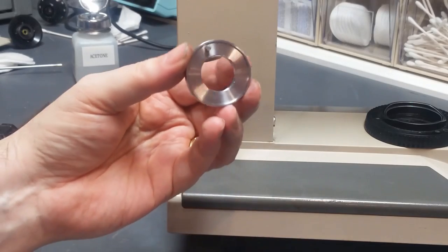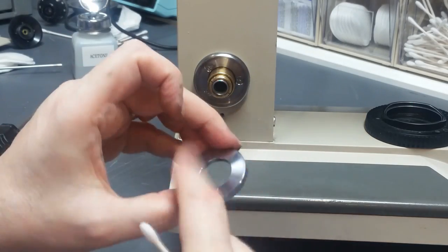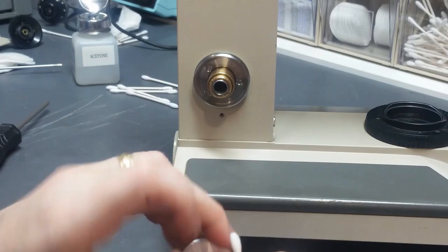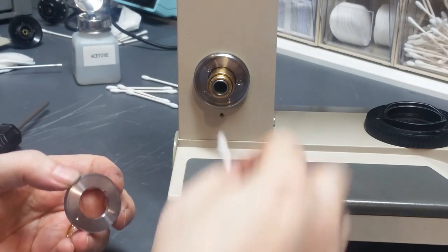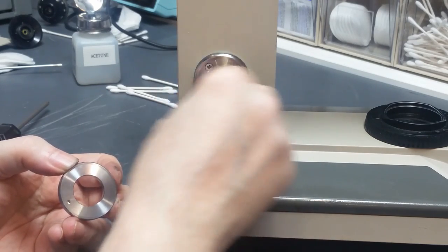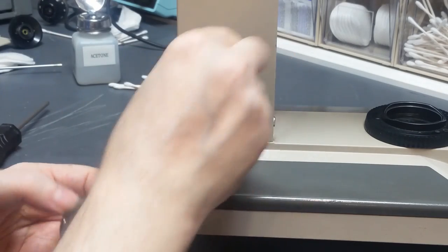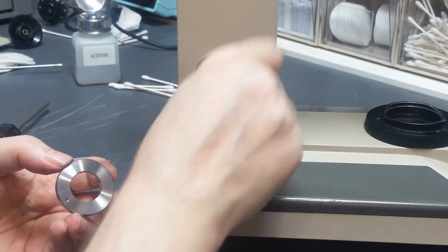Okay, the next piece to put in is this lock disc. It's a disc that's polished on both sides. Primarily the back is what's important. It's got a pin here that engages with the spring, and it's very important when you do this. I can't stress enough that cleanliness is critical here. This surface in here I'm cleaning now with acetone. There should not be any finger oils or grease or anything of any sort here. If this area is not surgically clean, then this disc won't slide on this as it should, and your mechanism won't work properly.